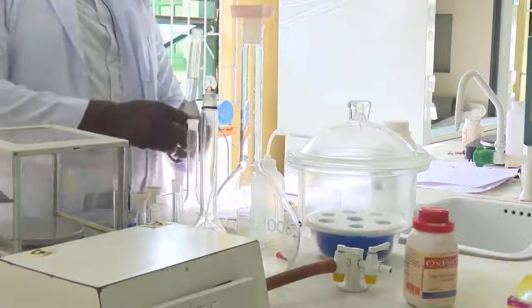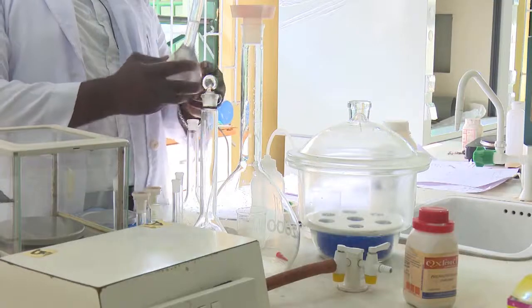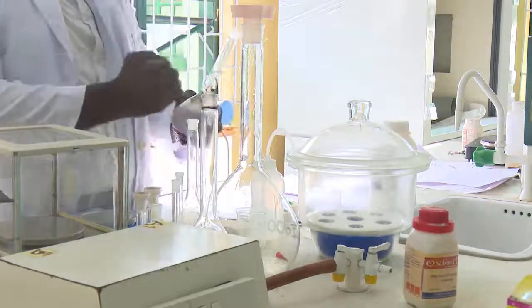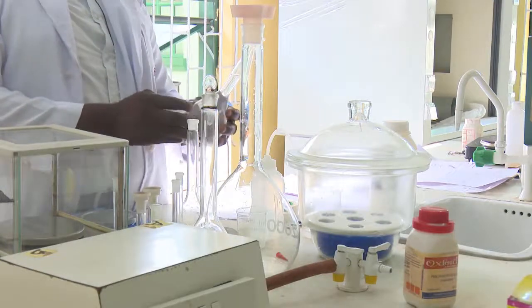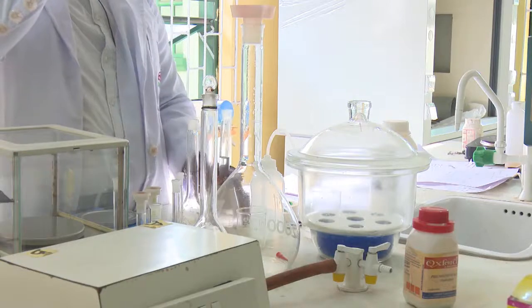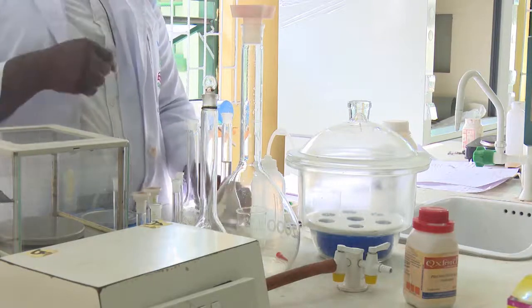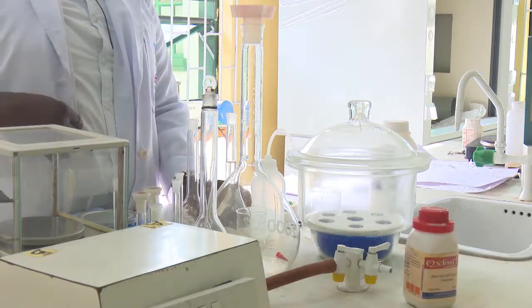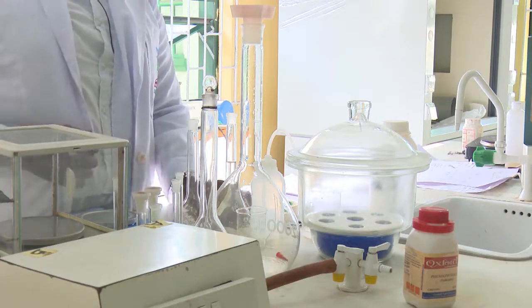Thank you. We are coming back to our preparation, having done the initial one, which is 1 molar. Now we need to prepare a lower concentration. How do we do that? We are going to use a formula called the serial dilution formula, as you were told in your class initially, and that is M1V1 = M2V2.